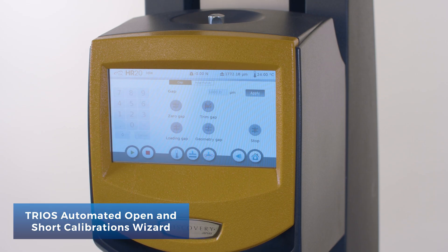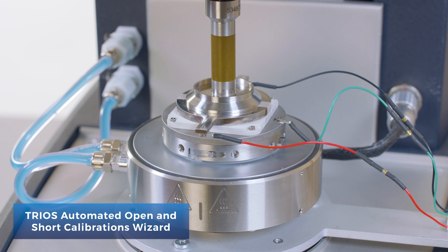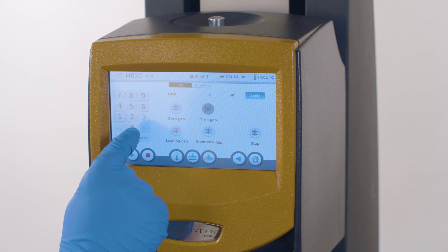Before starting the open and short calibrations, zero the gap, then set the gap to 1 millimeter.